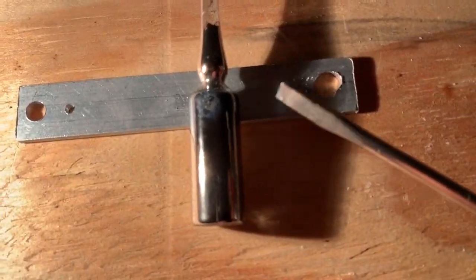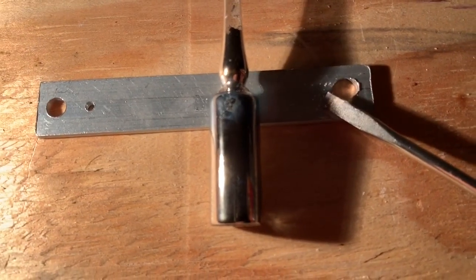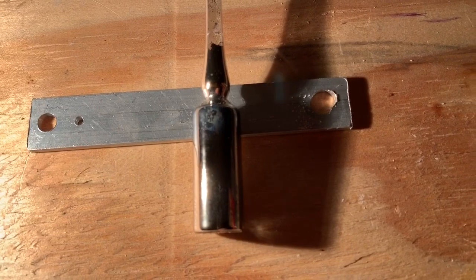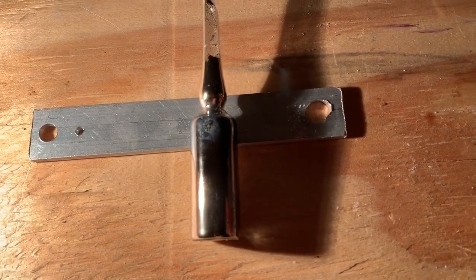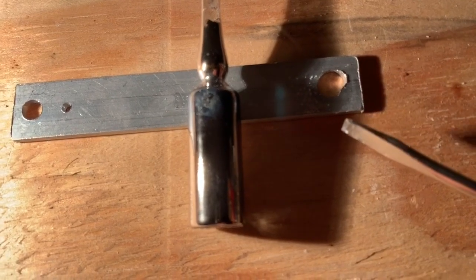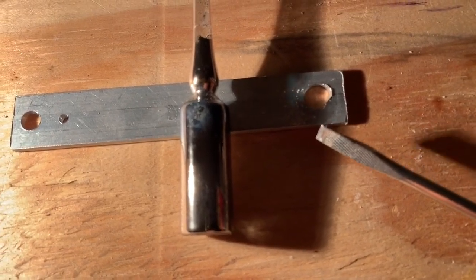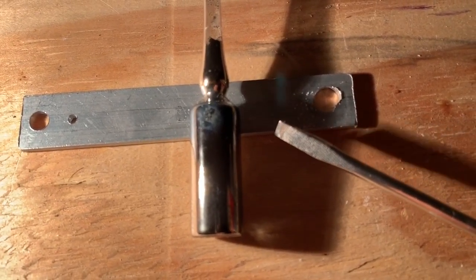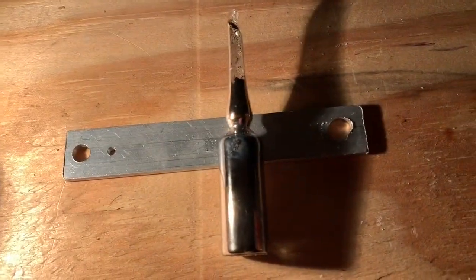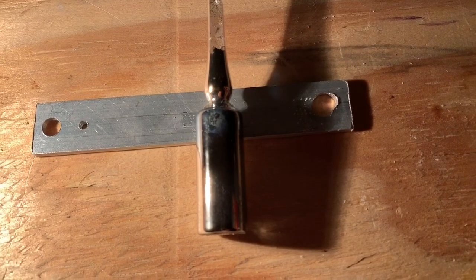Cesium has a golden color compared with this piece of aluminum. The reason for the golden color is it is highly photoelectric — it absorbs blue and violet light when illuminated with an incandescent bulb or with sunlight.